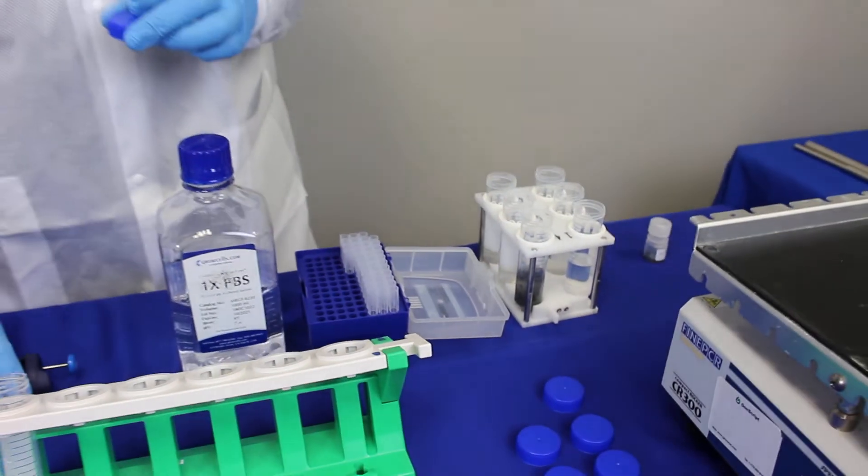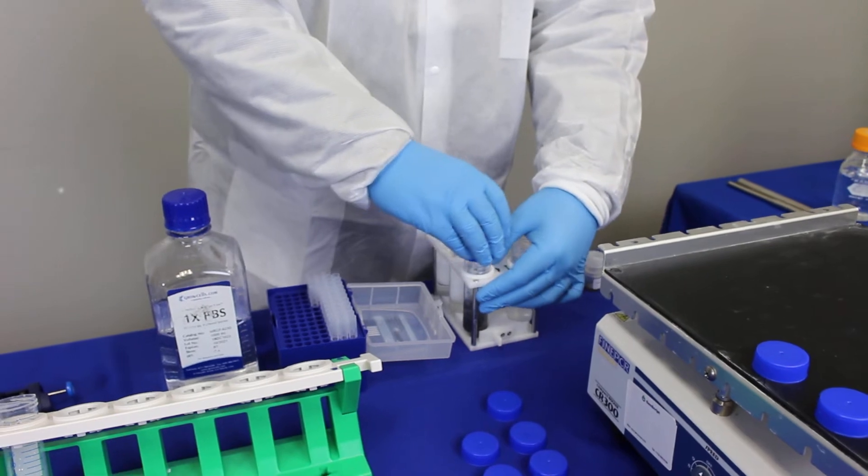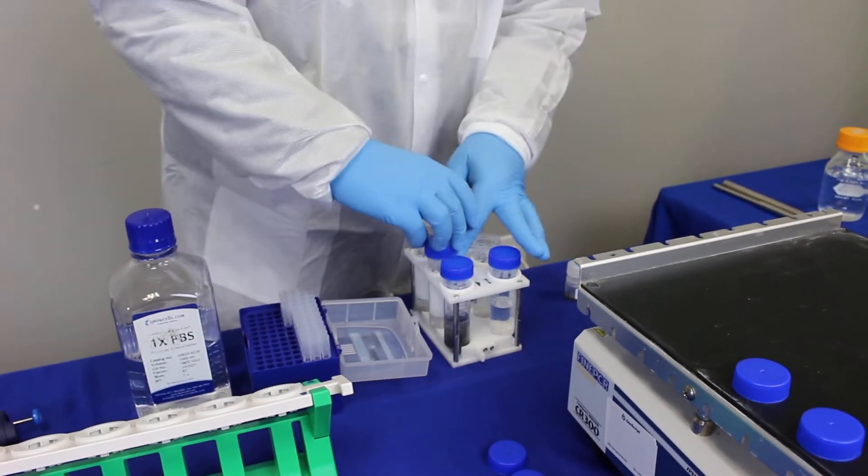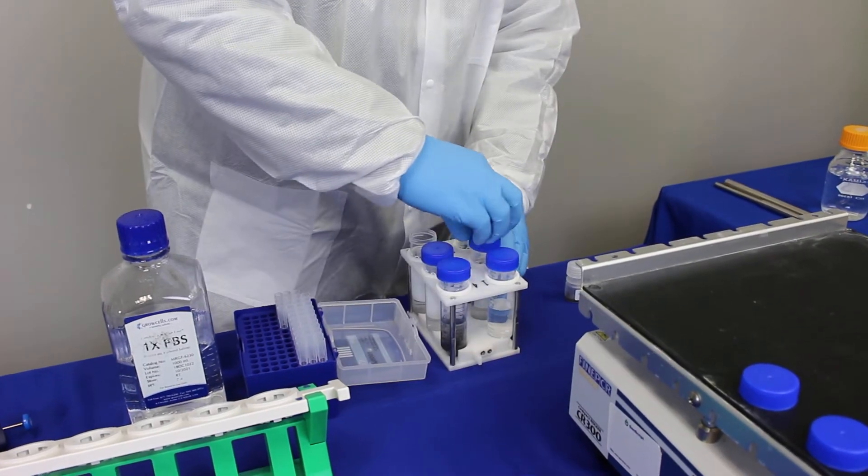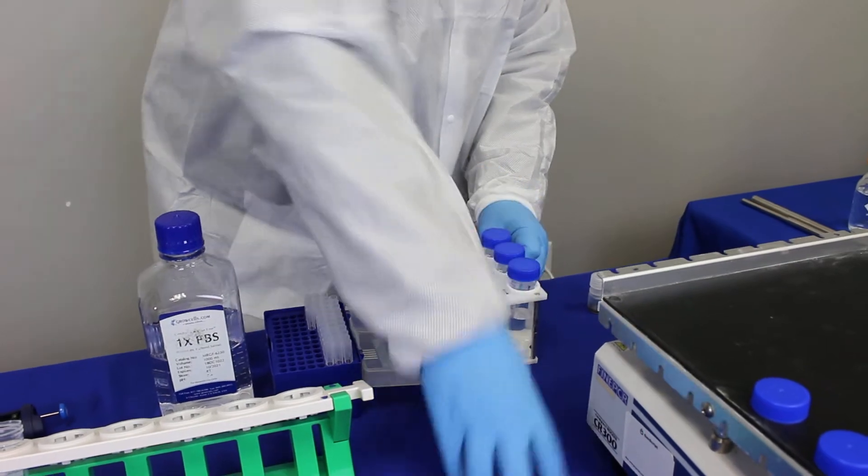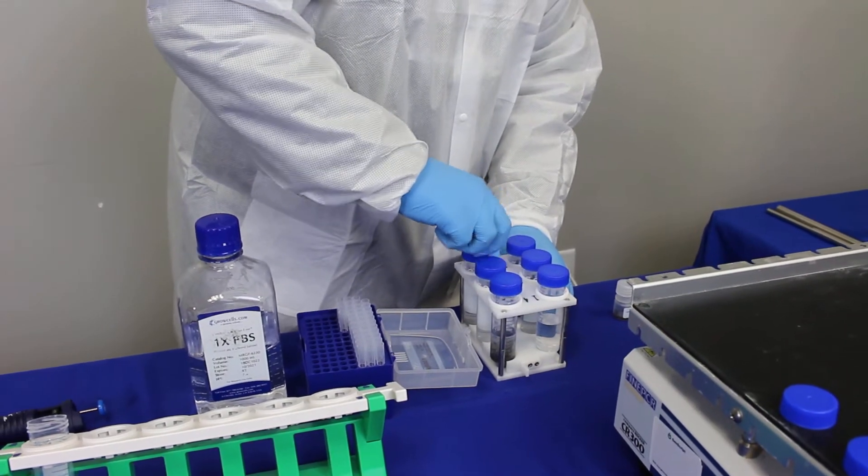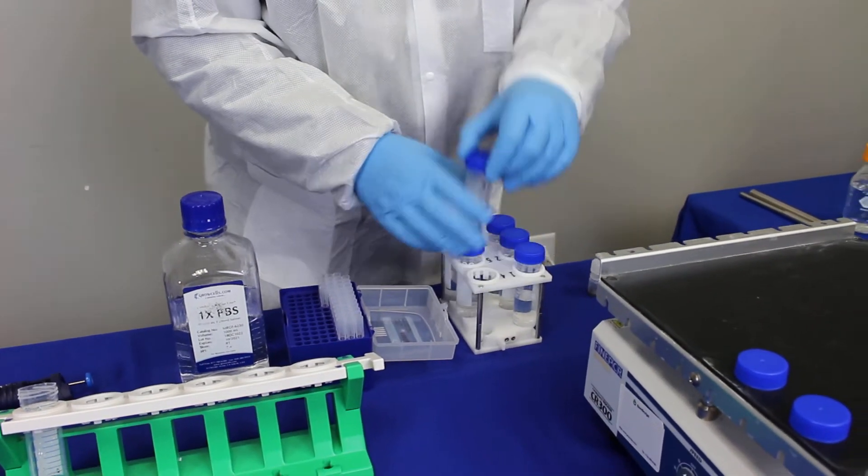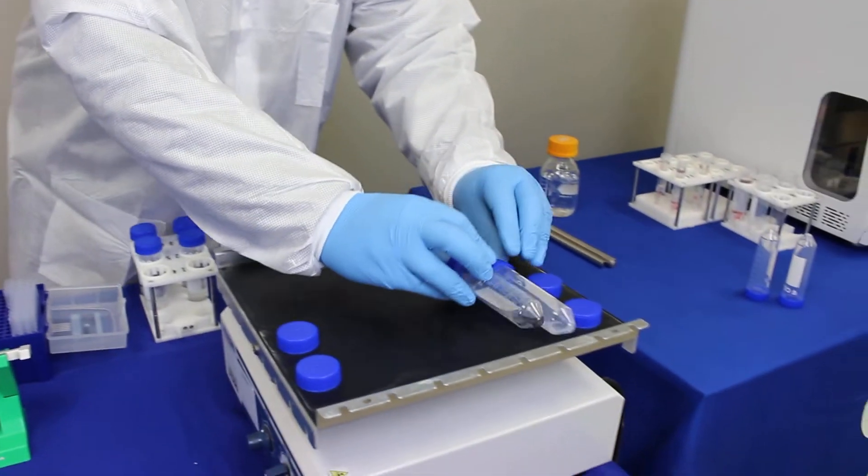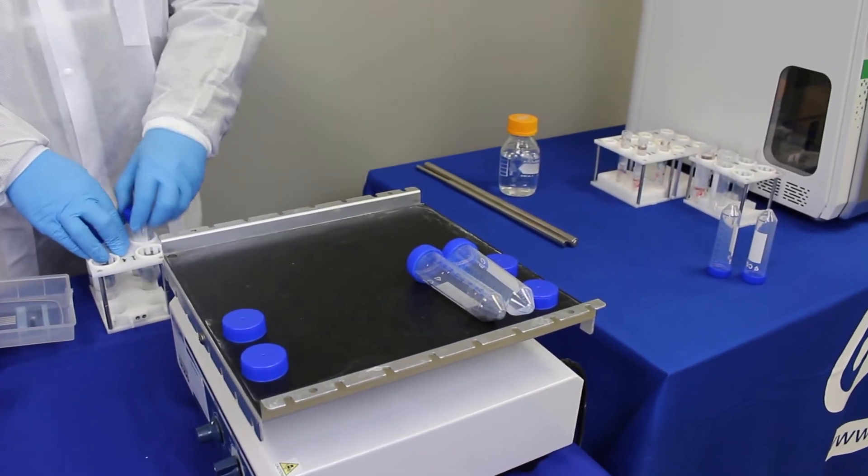Now your samples are ready for incubation, so you just cap all the tubes. We have already added the magnetic beads to the other tubes. Make sure they are nice and tight. You just put them on the shaker.